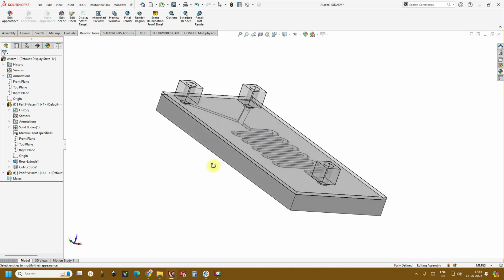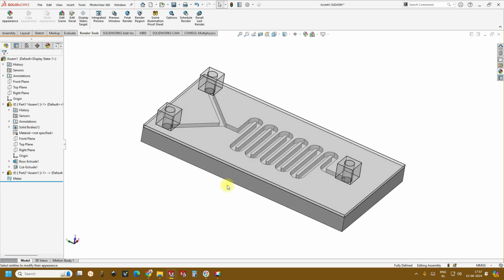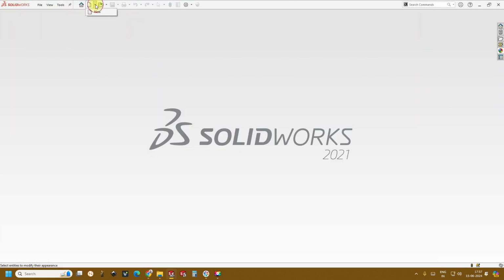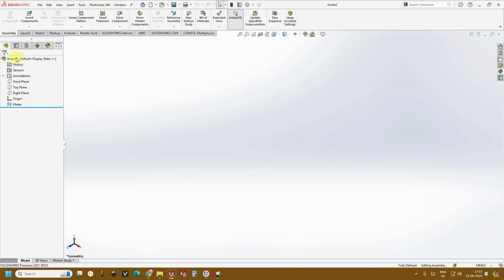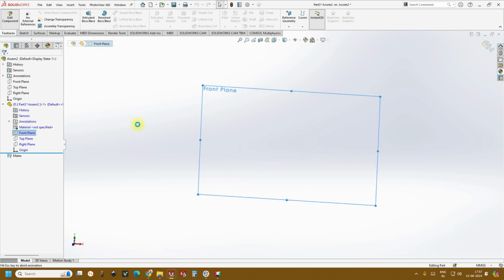So moving ahead, today we'll be doing this 3D Y channel integrated serpentine microfluidic channel. Something similar we'll be doing today. So let's close this first. Now, like we did in the previous design of the Y channel, the same thing we'll be doing. Select the assembly, click OK, and now go back to assembly, insert the new part, click on the screen, edit the new part, front plane.